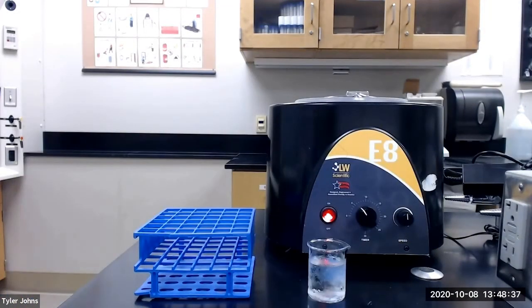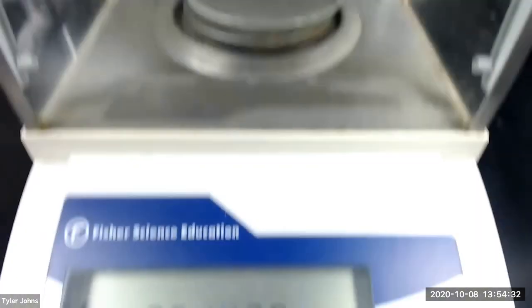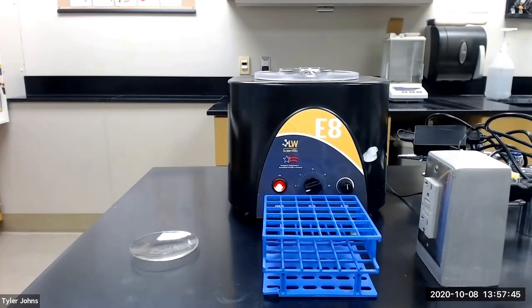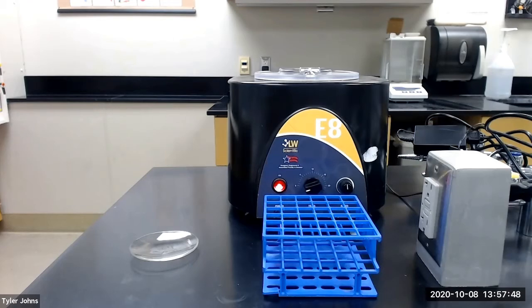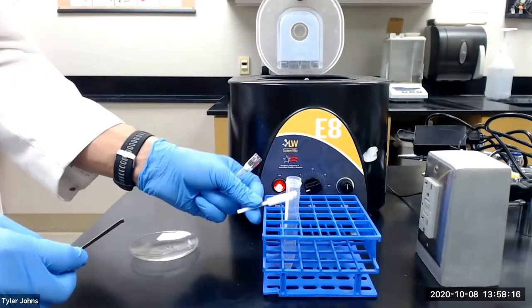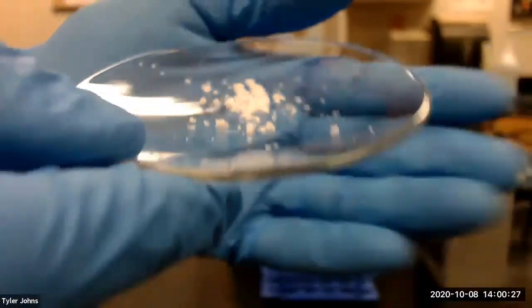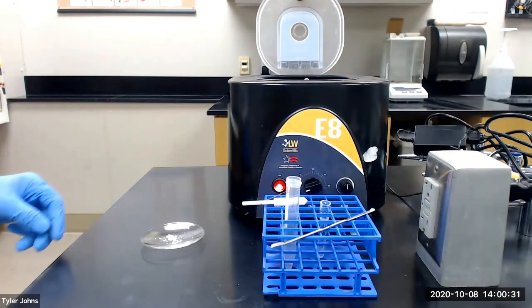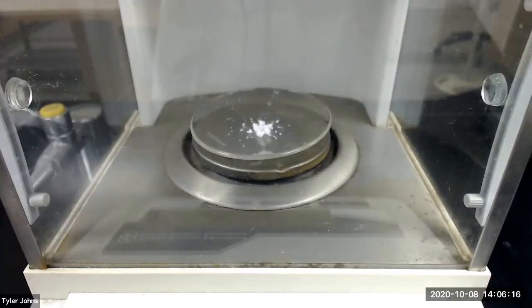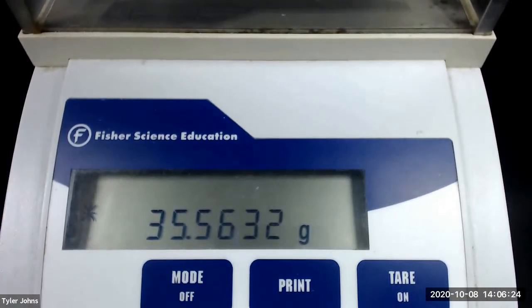While our Craig tube is centrifuging, we need to pre-weigh a watch glass. The mass of our pre-weighed watch glass is 35.4439 grams. We next need to collect the crystals from our Craig tube onto our pre-weighed watch glass. The mass of our pre-weighed watch glass plus our purified acetaminophen final product is 35.5632 grams.